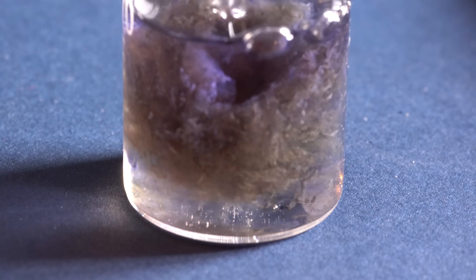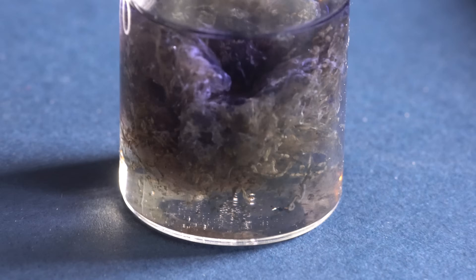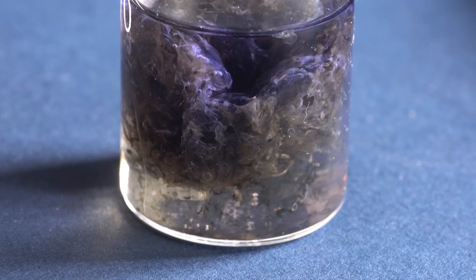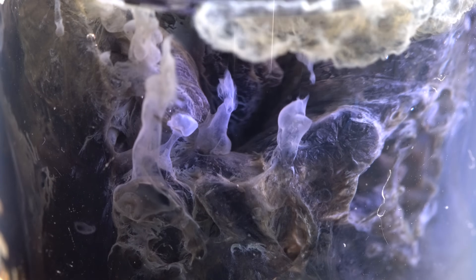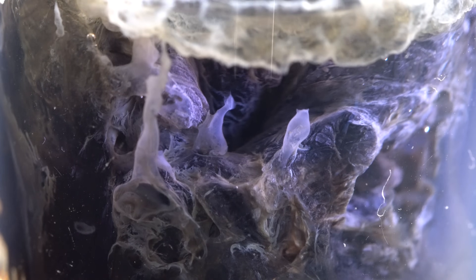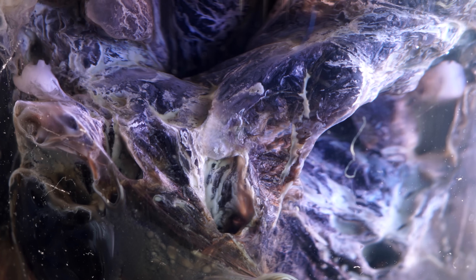I decided to conduct another experiment, where I would add an alkali or sodium hydroxide to the vanadium chloride. I was amazed by the result — it turned out to be some sort of cosmos within a test tube.